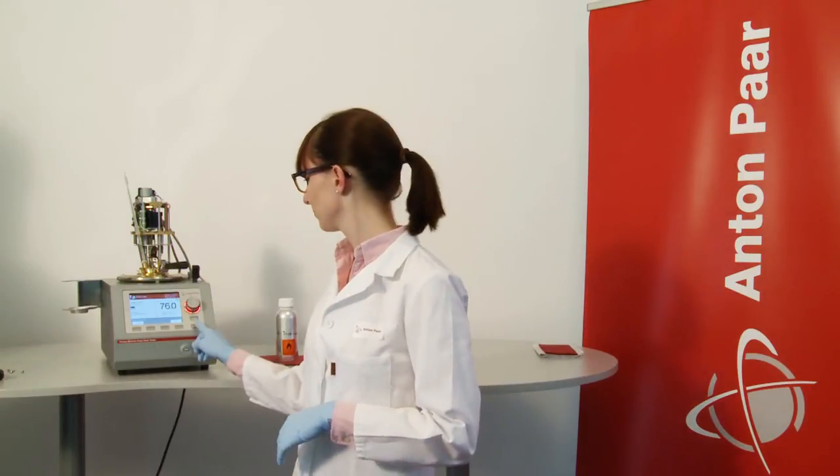How long does the calibration take? You can terminate the test at any time. All calibration values you have reached are registered and saved. Now you have calibrated your PT100 temperature probe and you are ready for new, highly reliable flashpoint tests using PMA5.